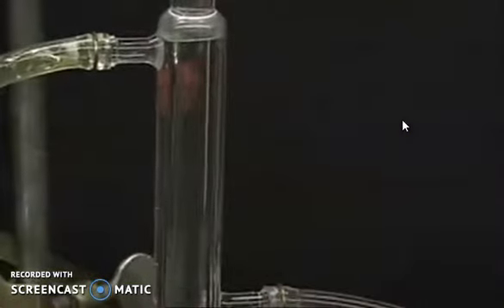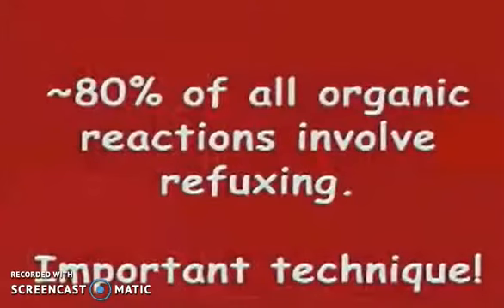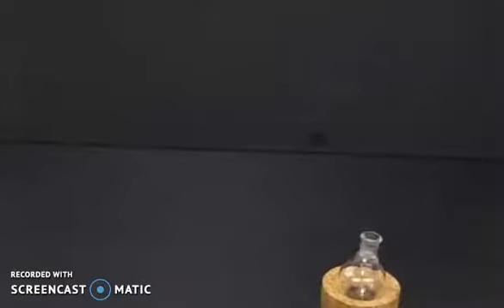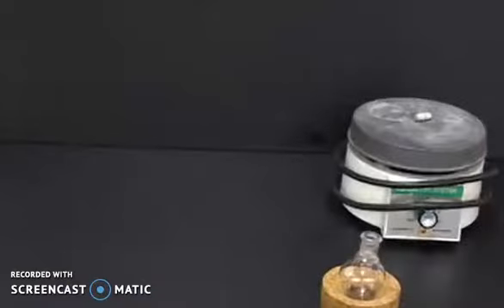Hello everyone, I am Dr. Serajeebagh Faisi. I welcome you to my YouTube channel. Today in this video I am going to show you refluxing. 80% of all organic reactions involve refluxing.